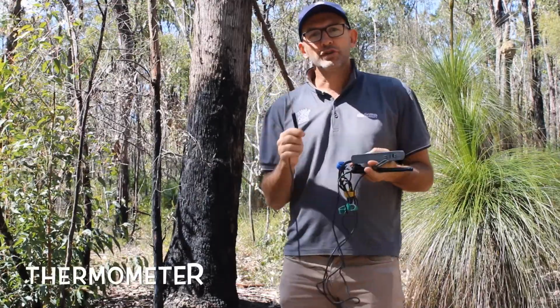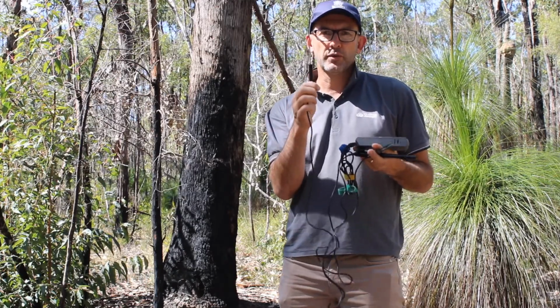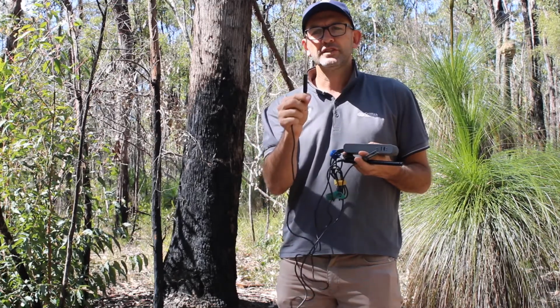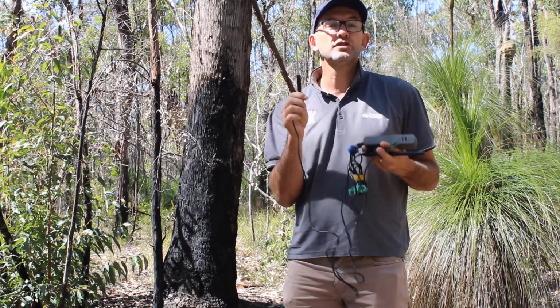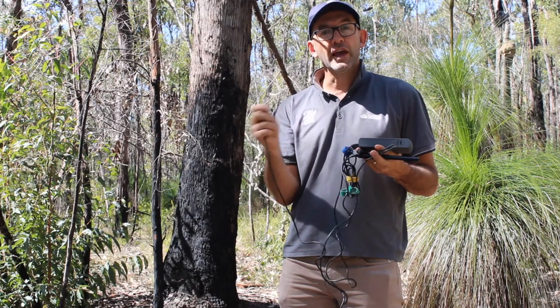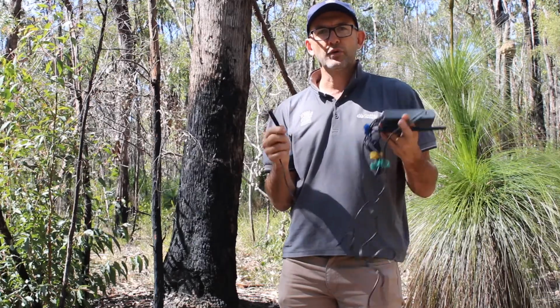The first probe I want to show you is the thermometer. Now, the thermometer doesn't look like what you expect a thermometer to look like. It actually is more like what you'd see on something like MasterChef, where they measure the temperature of food. This here is a metal cylinder and allows you to measure temperature. Now, the 2 temperatures that you're going to be measuring is firstly air temperature. So air temperature, you just need to wave this thermometer through the air, and it will actually measure the temperature, and you can read that recording on the Lab Quest.